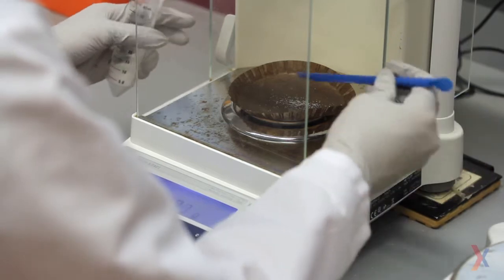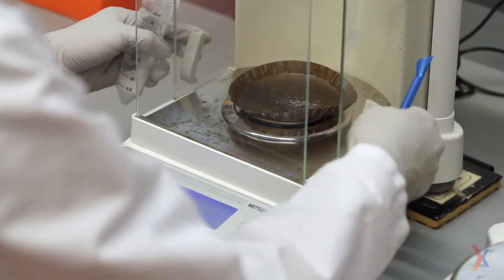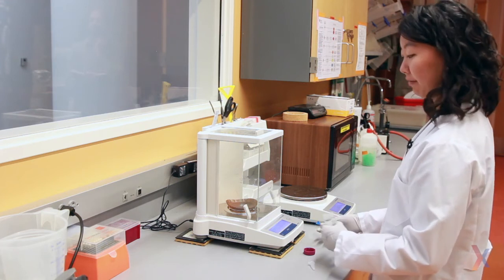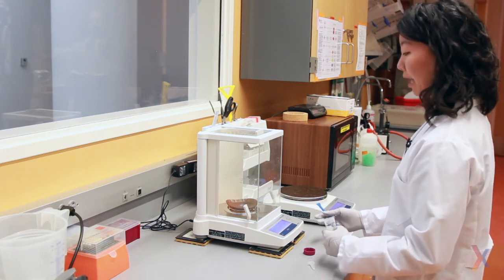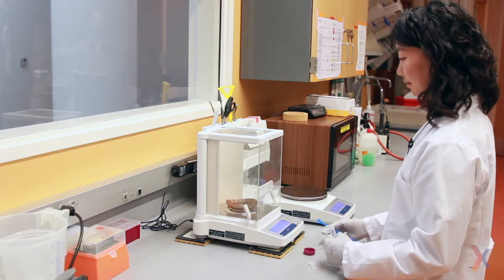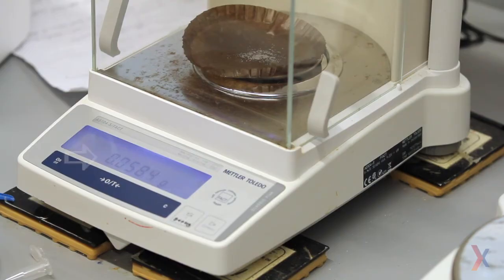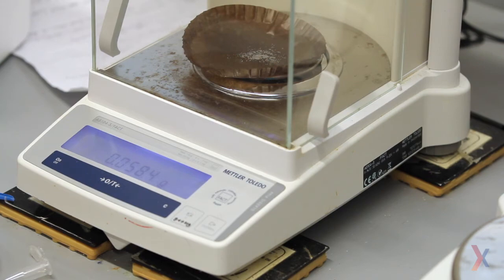Now I can take my sodium chloride and slowly and carefully start measuring out little by little. As I get closer, I want to slow down and give the scale time to recalibrate and come to equilibrium. I even close the plastic barrier to give the scale more time to calibrate without any air flow. And here you can see I've got 0.0584 grams, and we're ready to proceed.